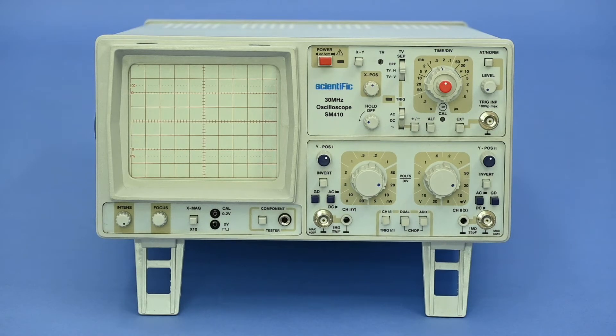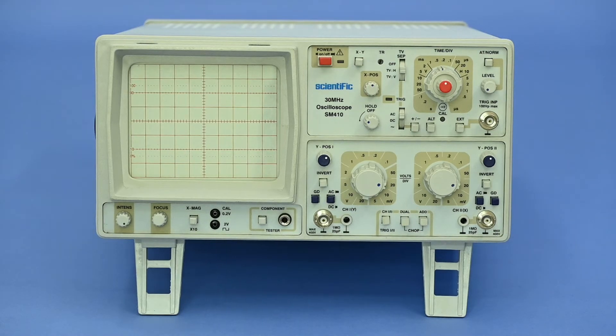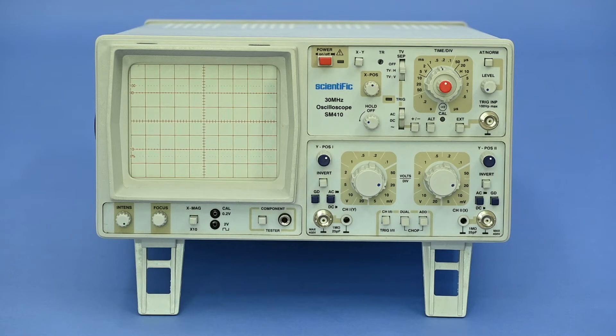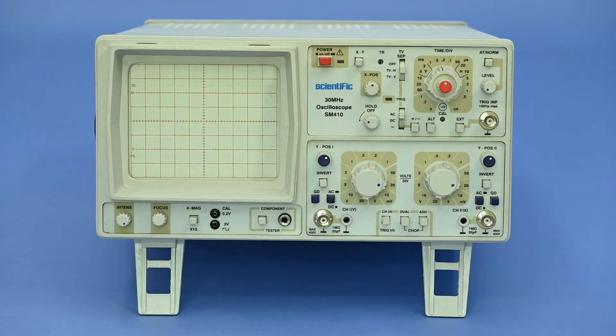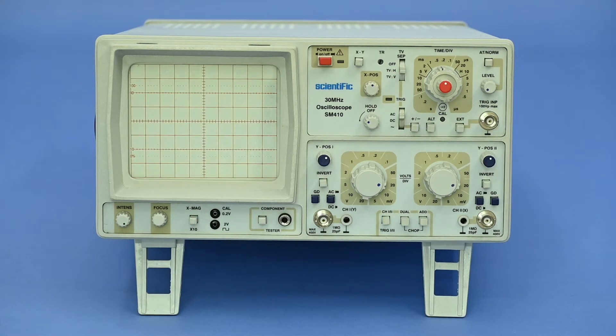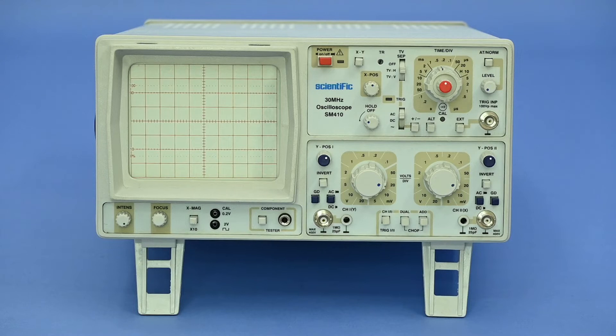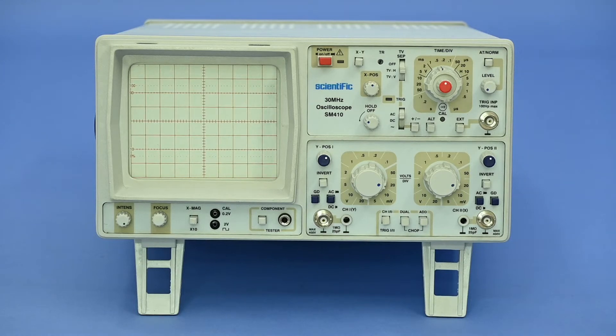An oscilloscope is not supplied with the unit but is required to see the resonance condition. Any oscilloscope is suitable which has the XY mode feature.